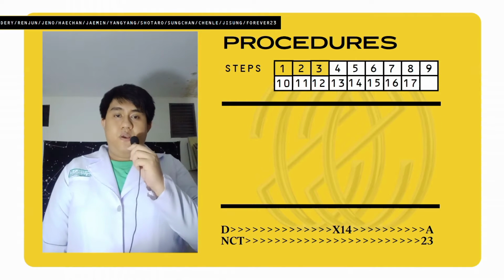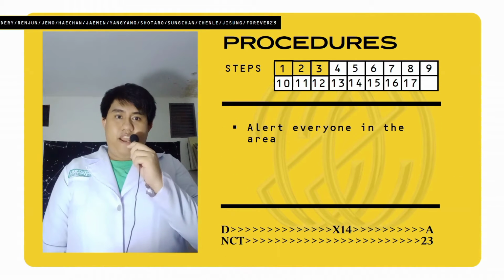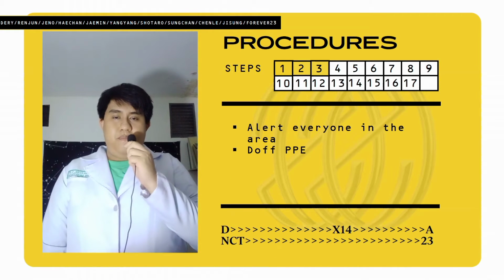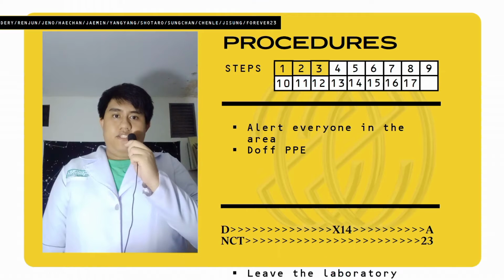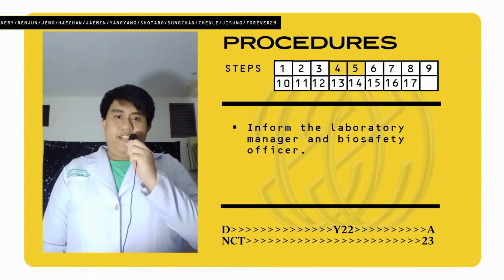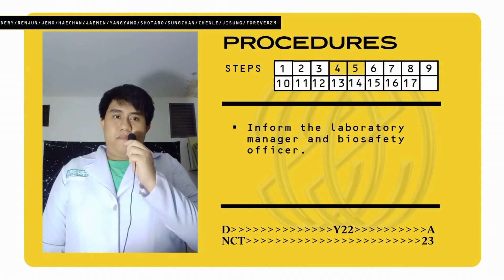For the procedures, what we have first is we have to alert everyone in the area. Second is we have to doff our PPE. Third is to leave the laboratory area for at least 30 minutes. After that, we have to inform the laboratory manager and the biosafety officer.